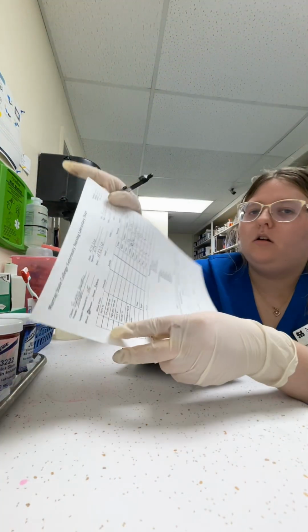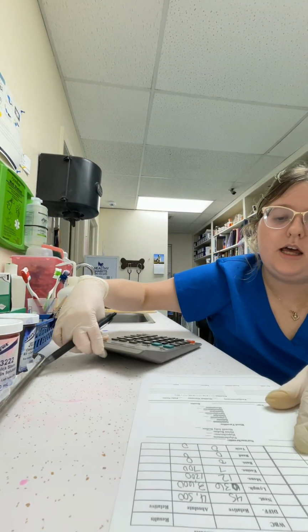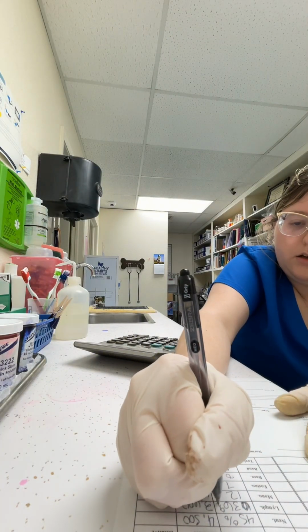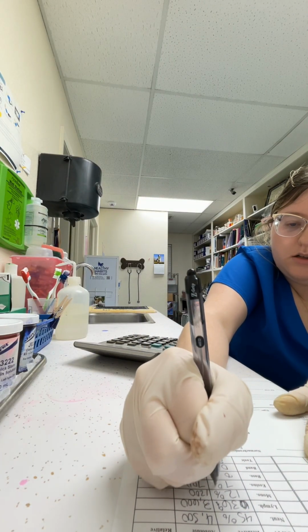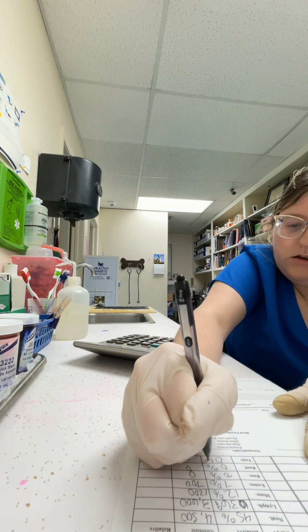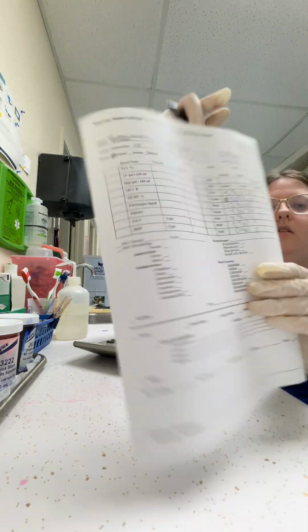These over here are actually considered percents. So when we record them, they're going to be with percentage signs, like this in the relative area.